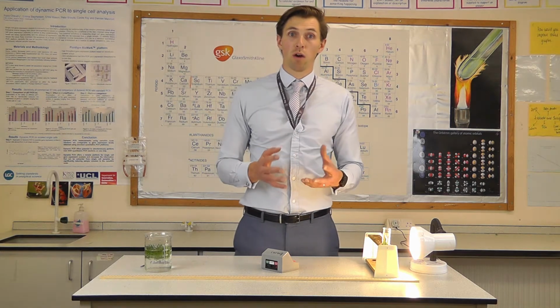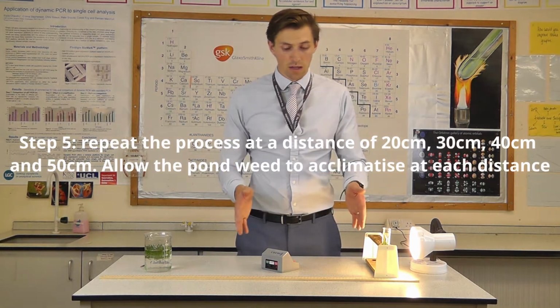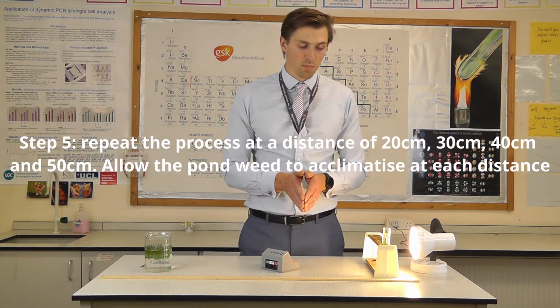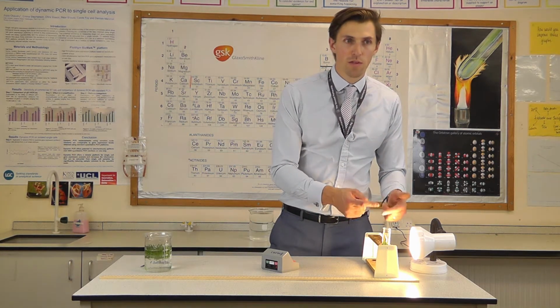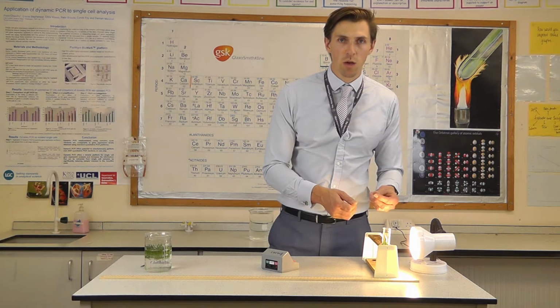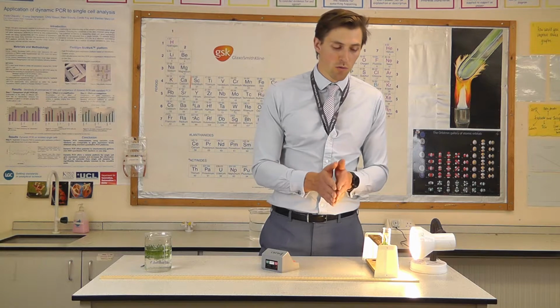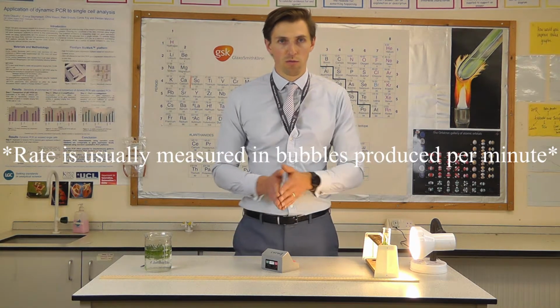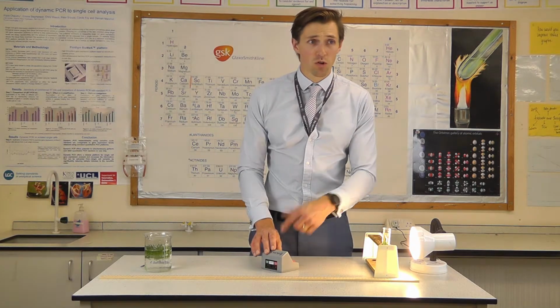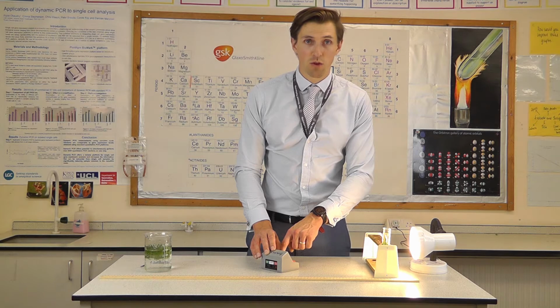I will then be able to plot a graph of volume of oxygen produced against distance from the bulb. Now for the time period, the production of oxygen in this particular boiling tube is relatively slow, so I'm going to do it for 5 minutes. It will give us a better set of results if we do it over a longer duration, especially as we're going further and further away from our bulb. So I'm going to hit the stopwatch, count the oxygen bubbles, and then we'll get our graph and table of results started.